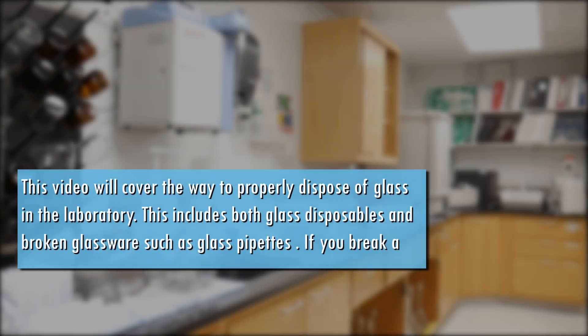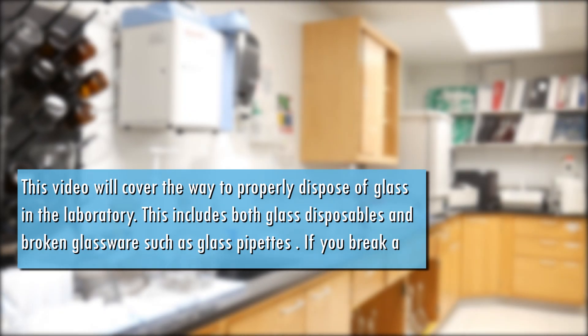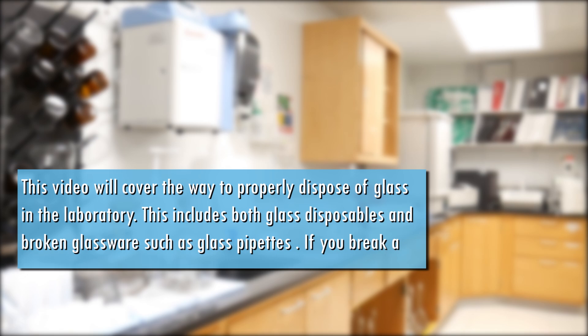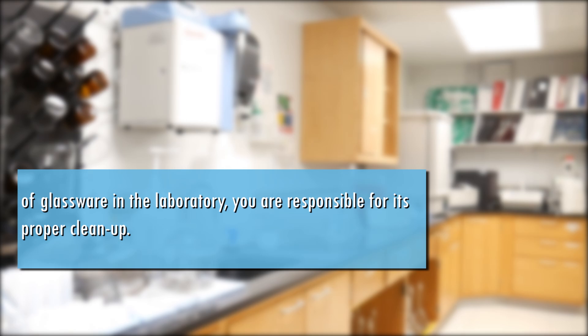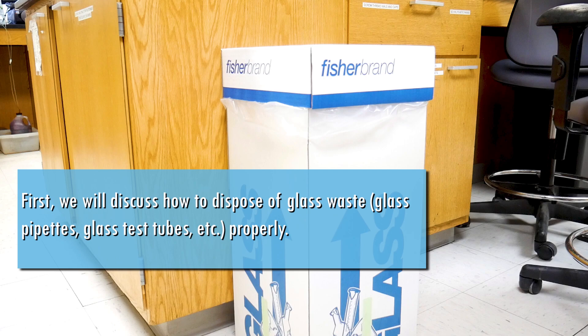This video will cover the way to properly dispose of glass in the laboratory. This includes both glass disposables and broken glassware, such as glass pipettes. If you break a piece of glassware in the laboratory, you are responsible for its proper cleanup. First, we will discuss how to properly dispose of glass waste.